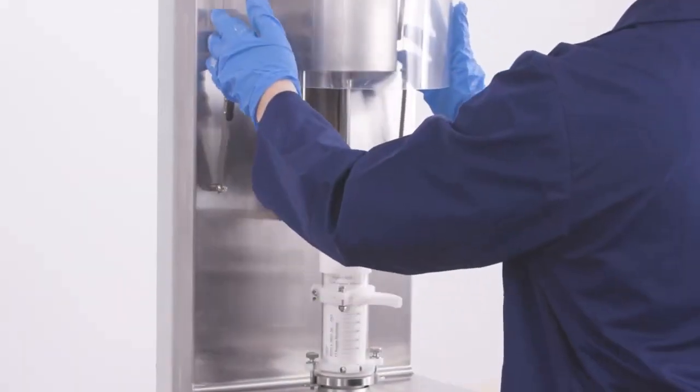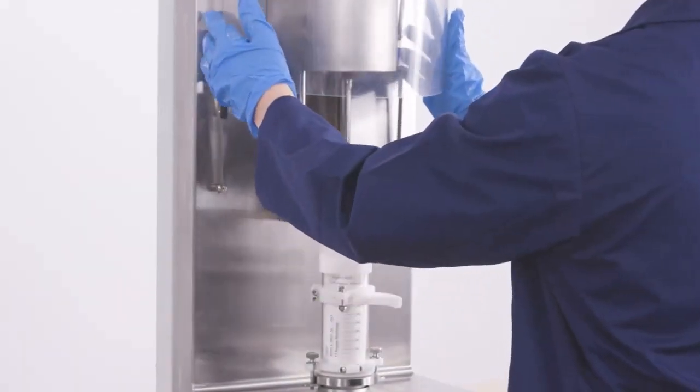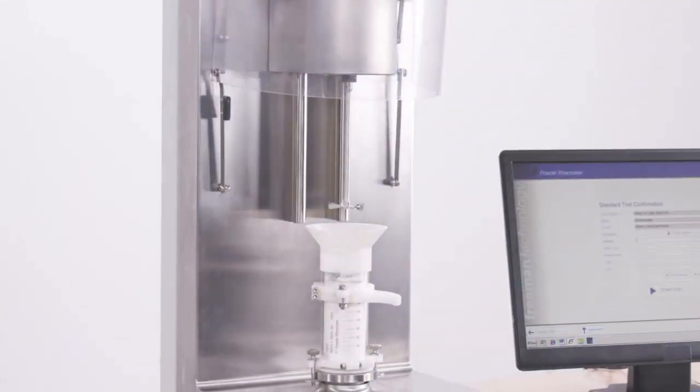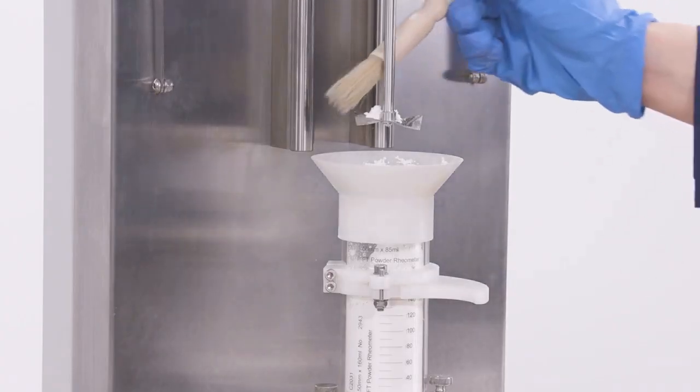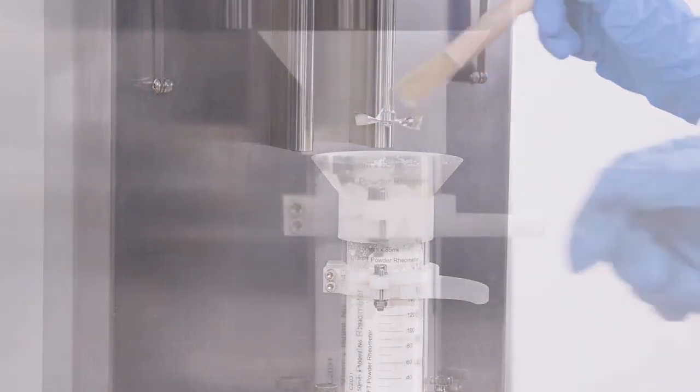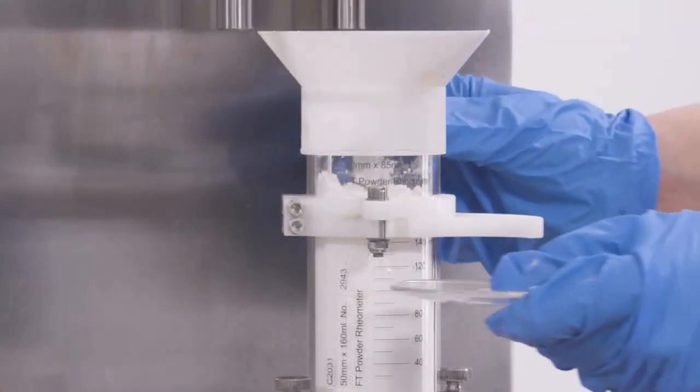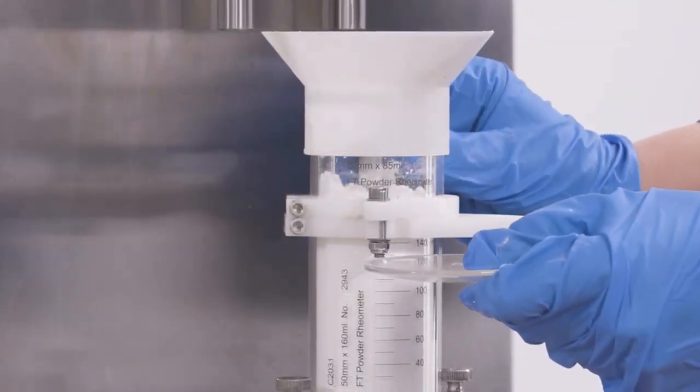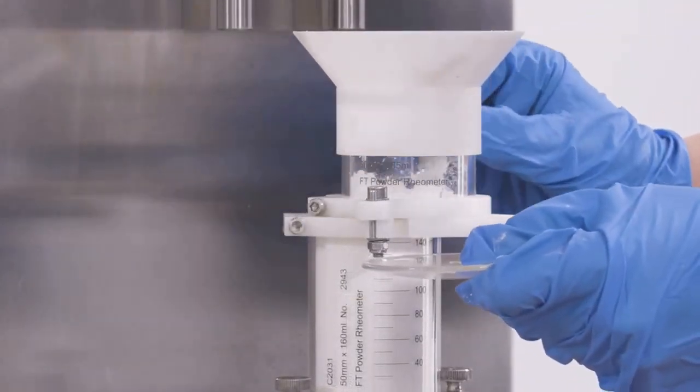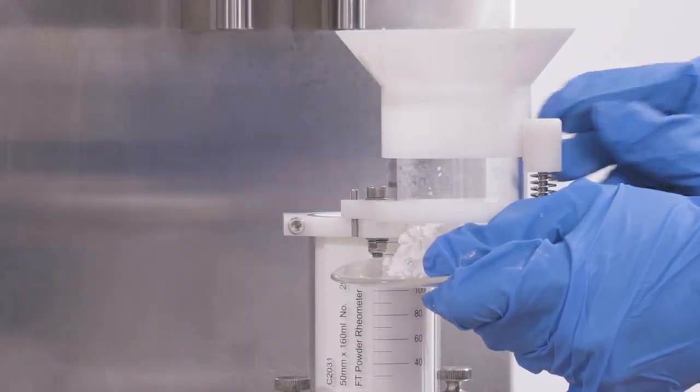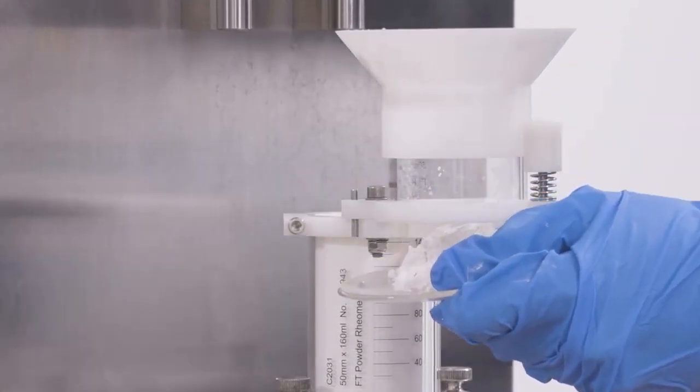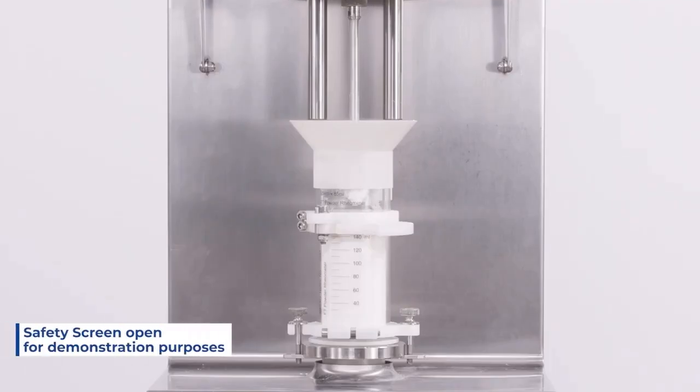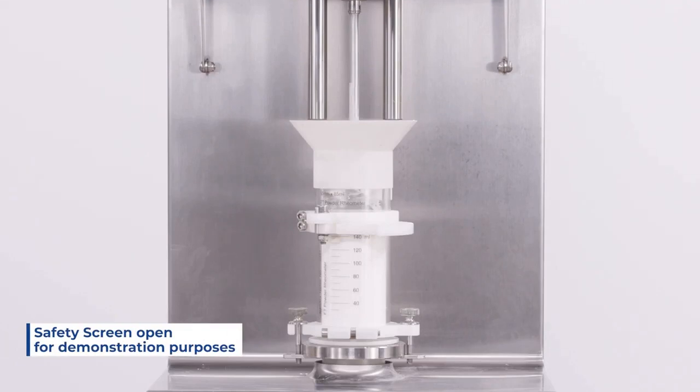Now that the initial conditioning cycle is complete, I will open the safety shield and brush off any excess powder that was stuck onto the blade before splitting the top half of the vessel open, removing any excess powder. I've now isolated a 160 milliliter powder sample. I will then return the vessel back to its closed position and close the safety shield before clicking OK to continue with the rest of the test.